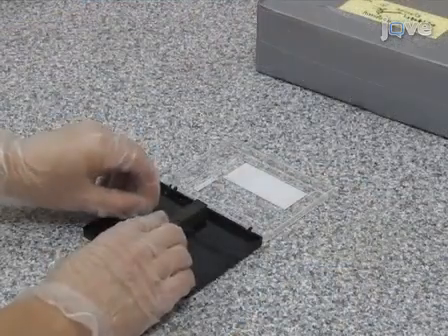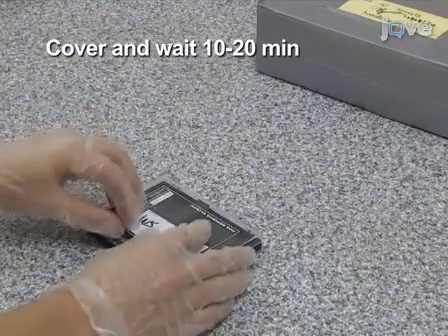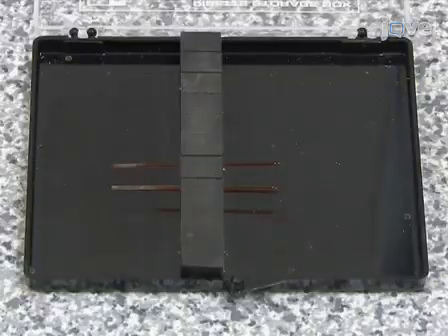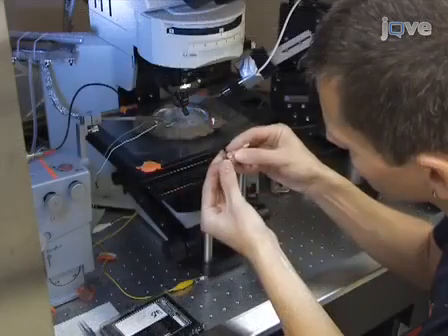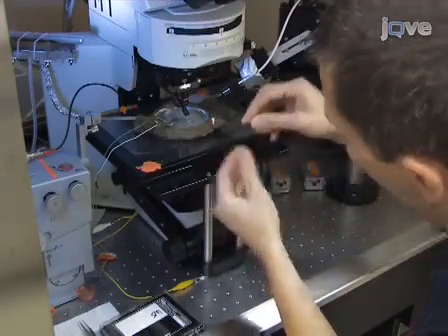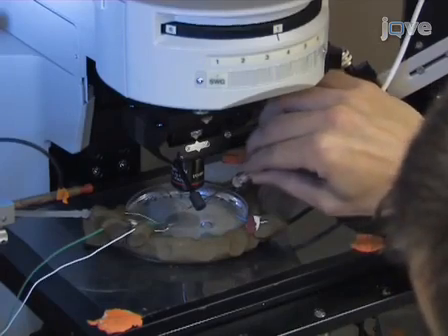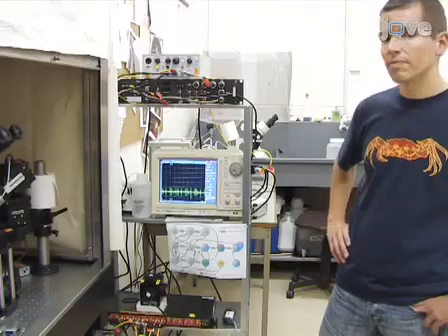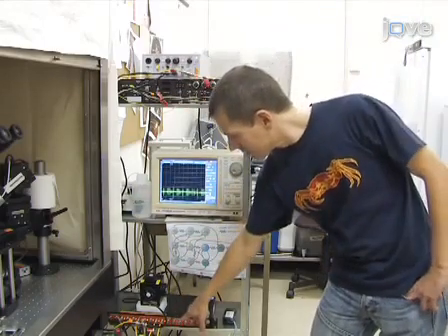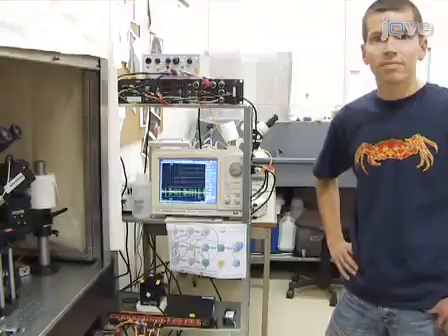Place the microelectrode back into a dark electrode storage box for 10 to 20 minutes to allow capillary action to pull the dye solution into the fine tip of the electrode. After 10 to 20 minutes, place the microelectrode into an electrode holder and attach it to the head stage of the intracellular amplifier. The intracellular amplifier is connected to the data acquisition board that provides a pulse signal to drive current pulses into the microelectrode.